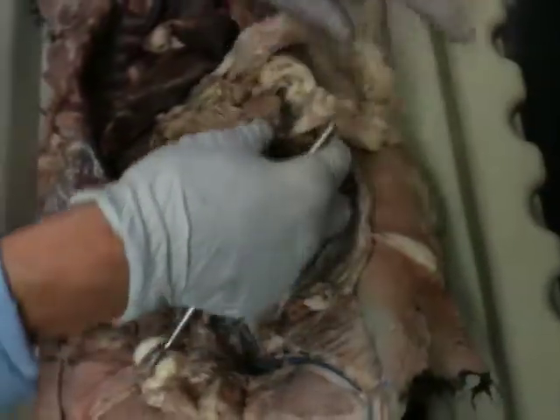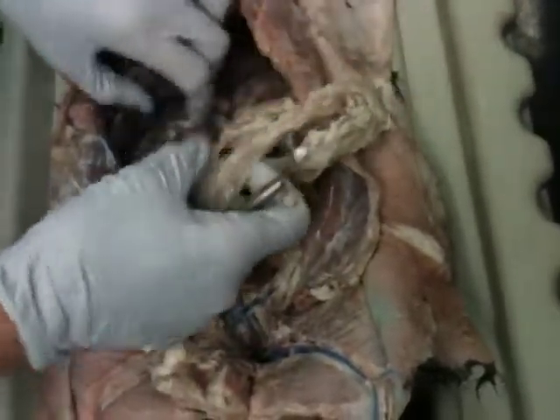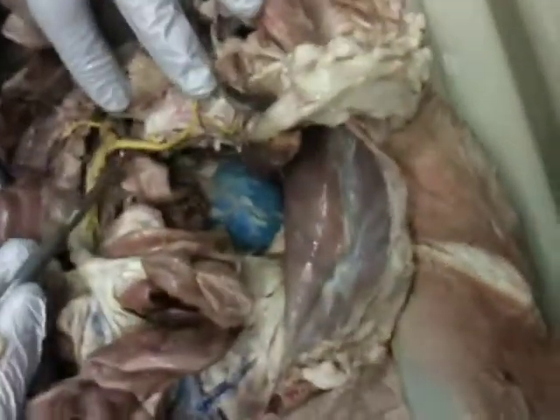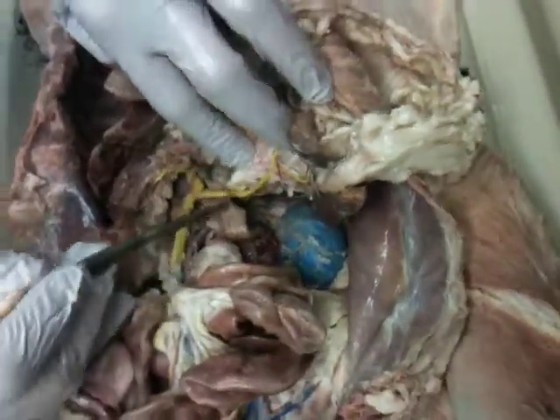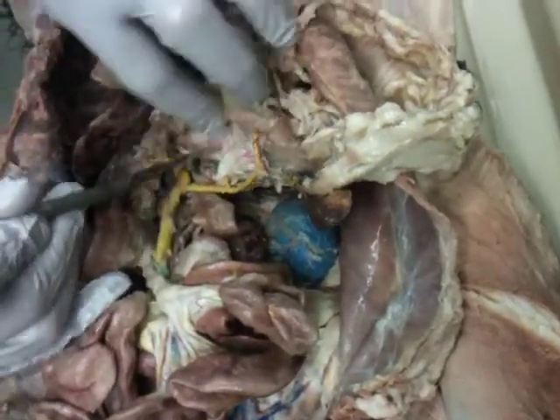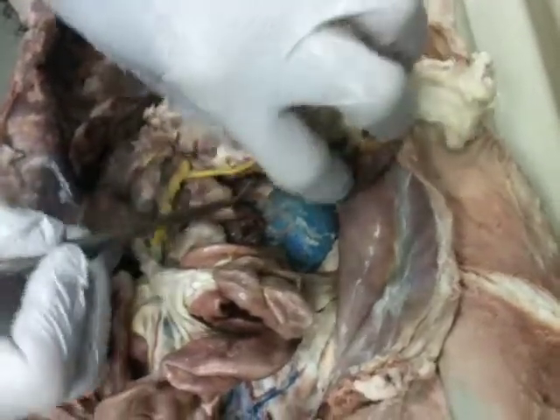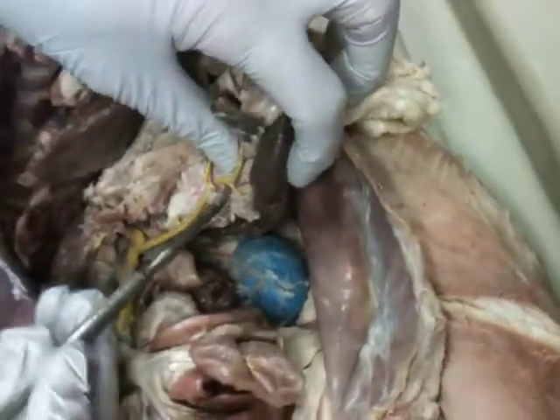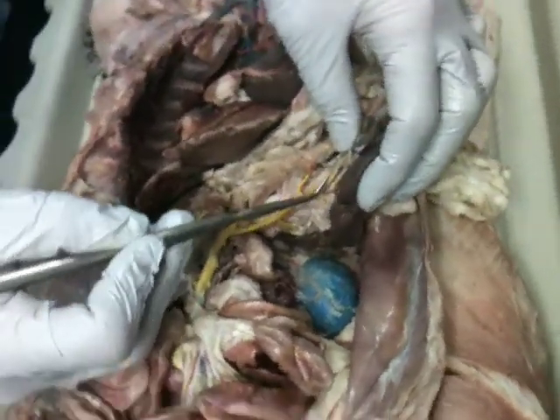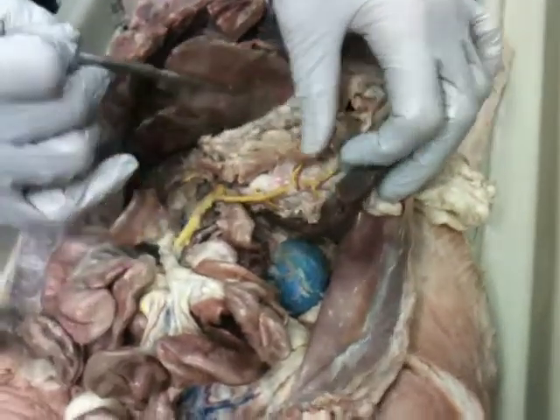Okay, so let's figure it out in here. So the gastrosplenic will send some branches off to the stomach. That one will eventually head up to the stomach area. And it will continue on as the splenic after it sends the branches off. It will divide into anterior and posterior splenic veins.